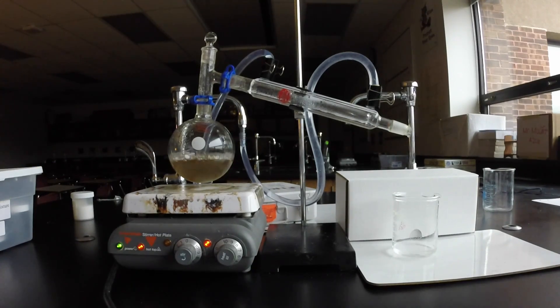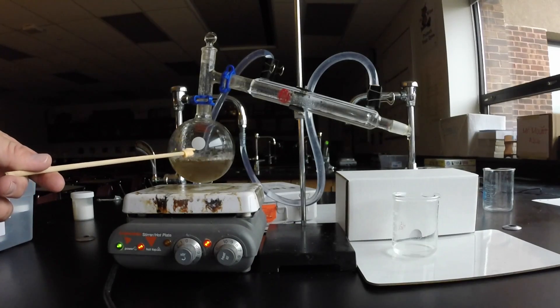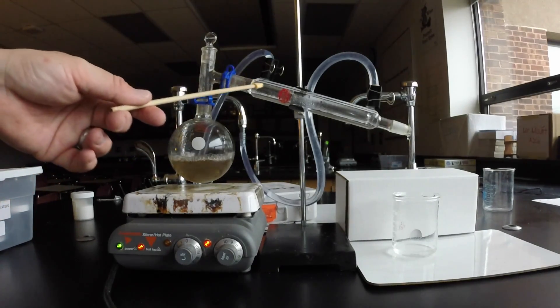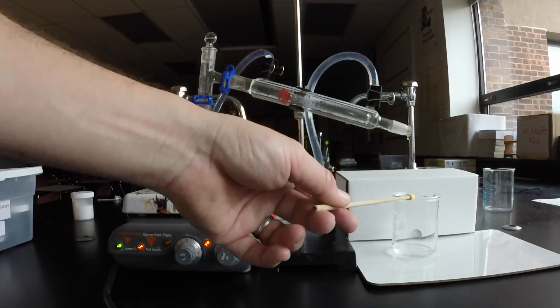What you're seeing is distillation in action. So I have a boiling flask, a condenser, and a collection beaker.